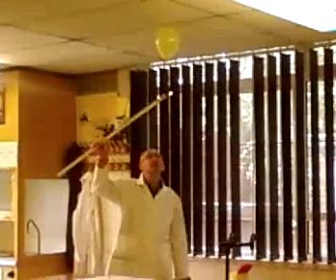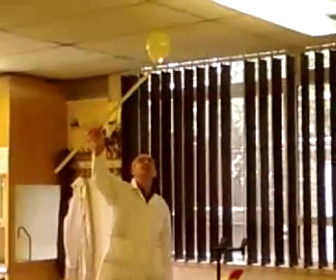If we mix them together, we'd get a much bigger reaction. Anyway, we've got water. Well done, Sean. Right, folks, if you could take off your safety goggles.